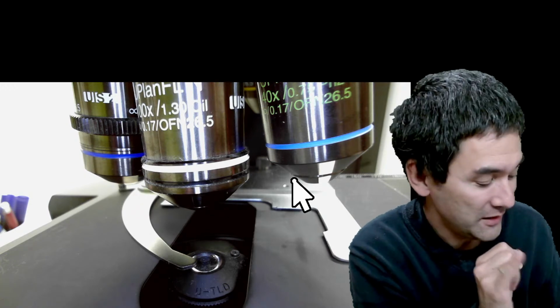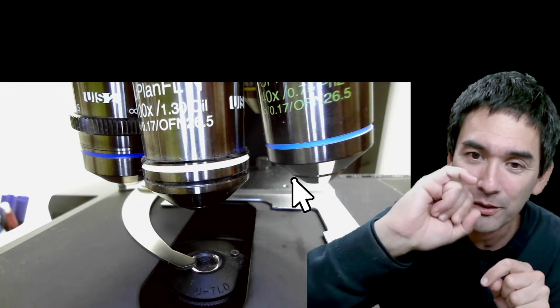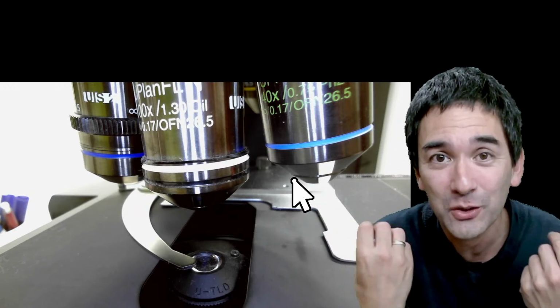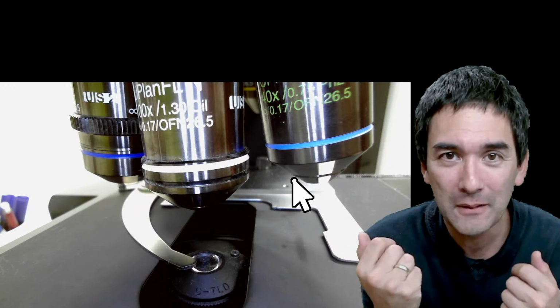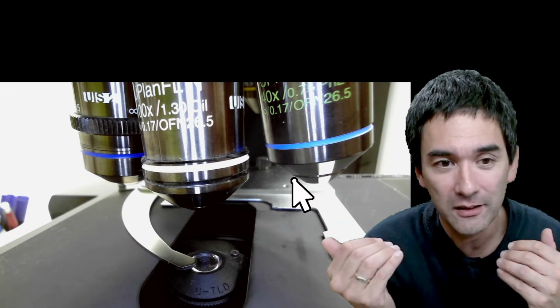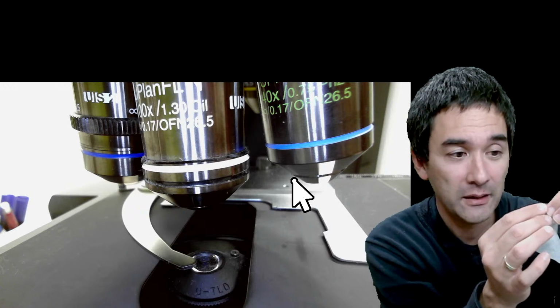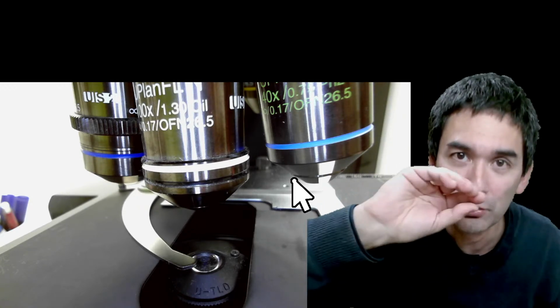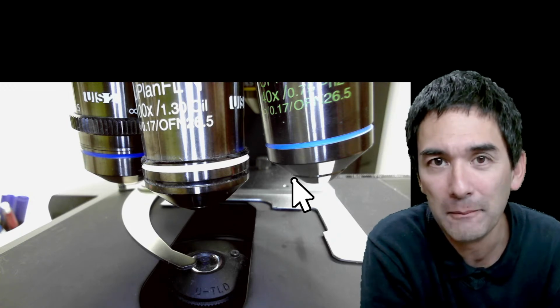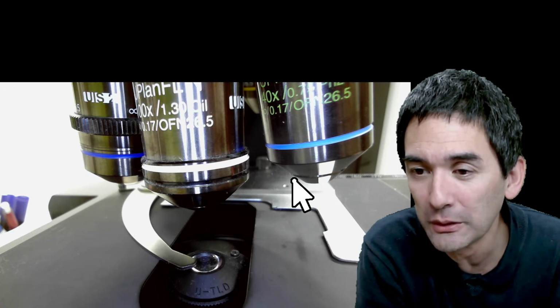Take some cleaning paper and take your fingernail and actually start. If there's too much dirt and oil in there, start scratching it out a little bit. And he says, don't be afraid. The lenses can actually withstand more than you might think. He said many people are afraid of doing that because they're afraid of damaging the lens, but he says that's okay. The lenses are designed for it. Of course, you don't want to use any sharp object, but if you use some lens tissue paper, you actually sometimes have to really go in a little bit to get the dirt out. So just to show you that we have to be careful, but there's no point in exaggerating here.